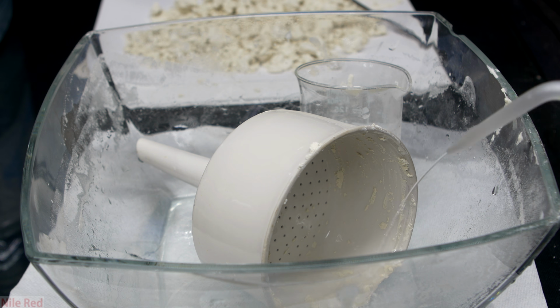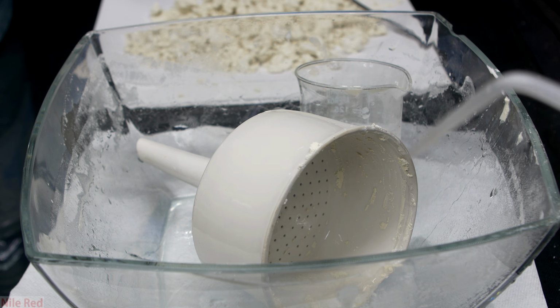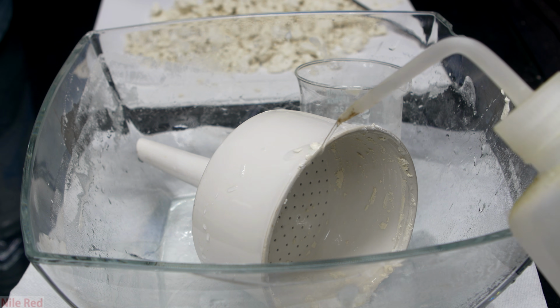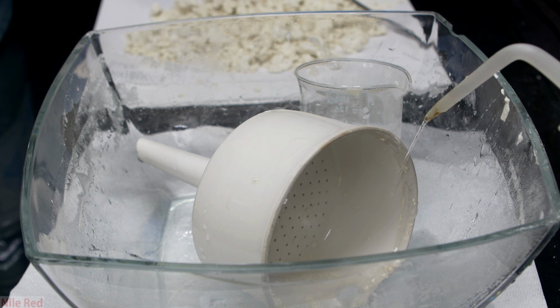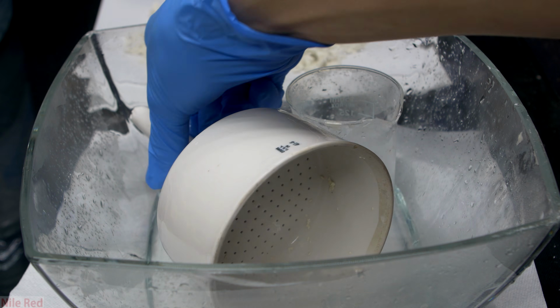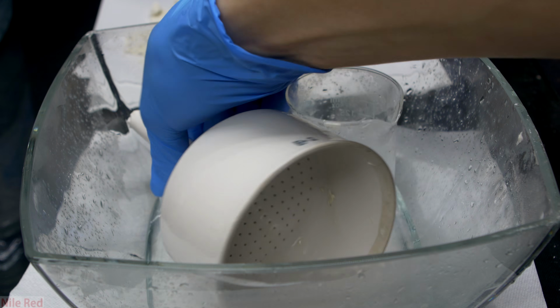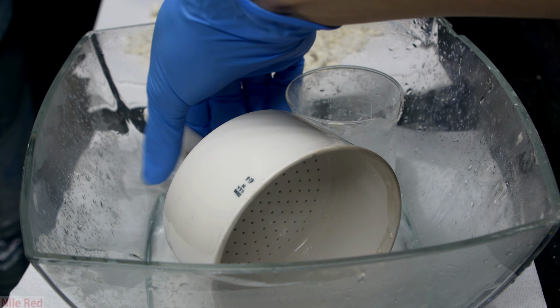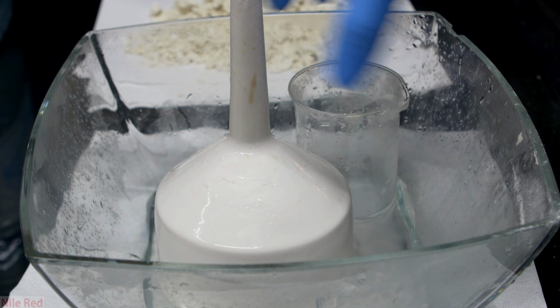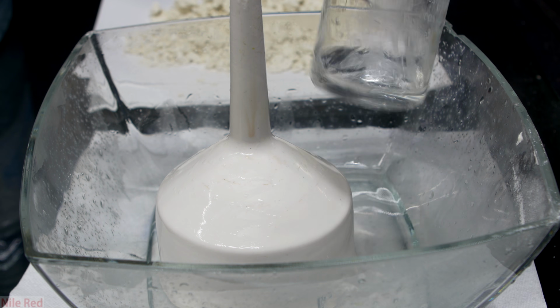Mercury thiocyanate is not soluble in water, so we need to clean it with hydrochloric acid. The hydrochloric acid will react with it to form mercury chloride, which is soluble in water. Just using hydrochloric acid in a squirt bottle, I cleaned the dish, the Buchner funnel, and the beaker that I used. After just a few minutes, everything was relatively clean, but it's important to note that we've just solubilized the mercury salts. Soluble mercury salts are much more dangerous than the insoluble ones, so we have to be really careful and add everything to the proper mercury waste container.